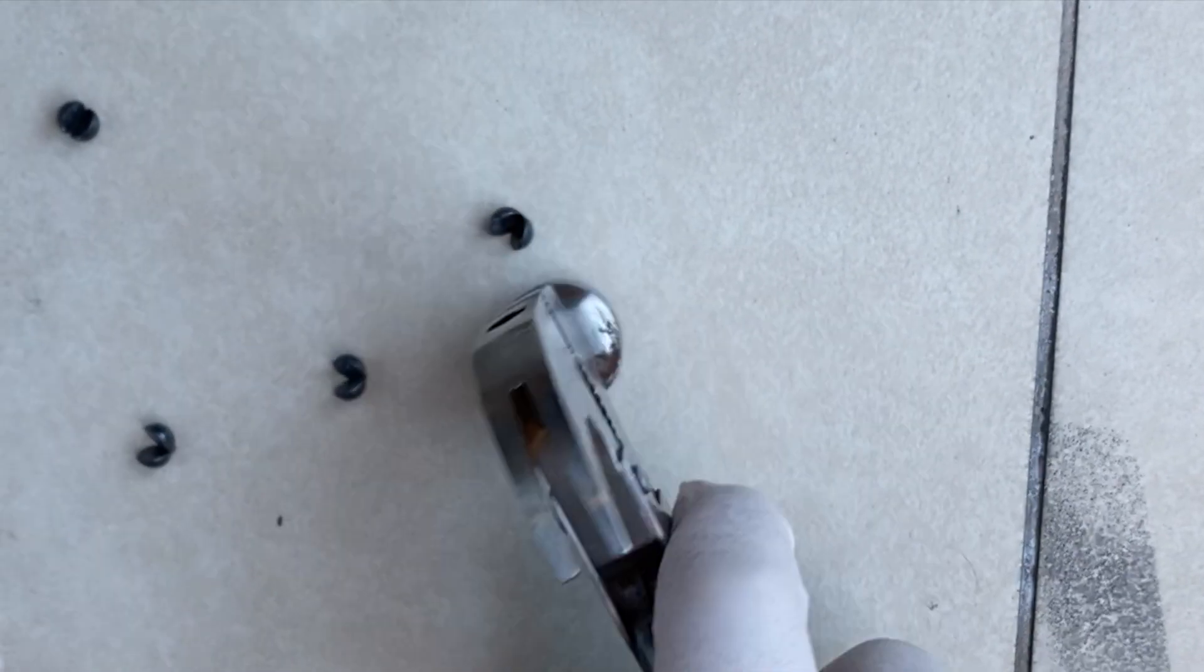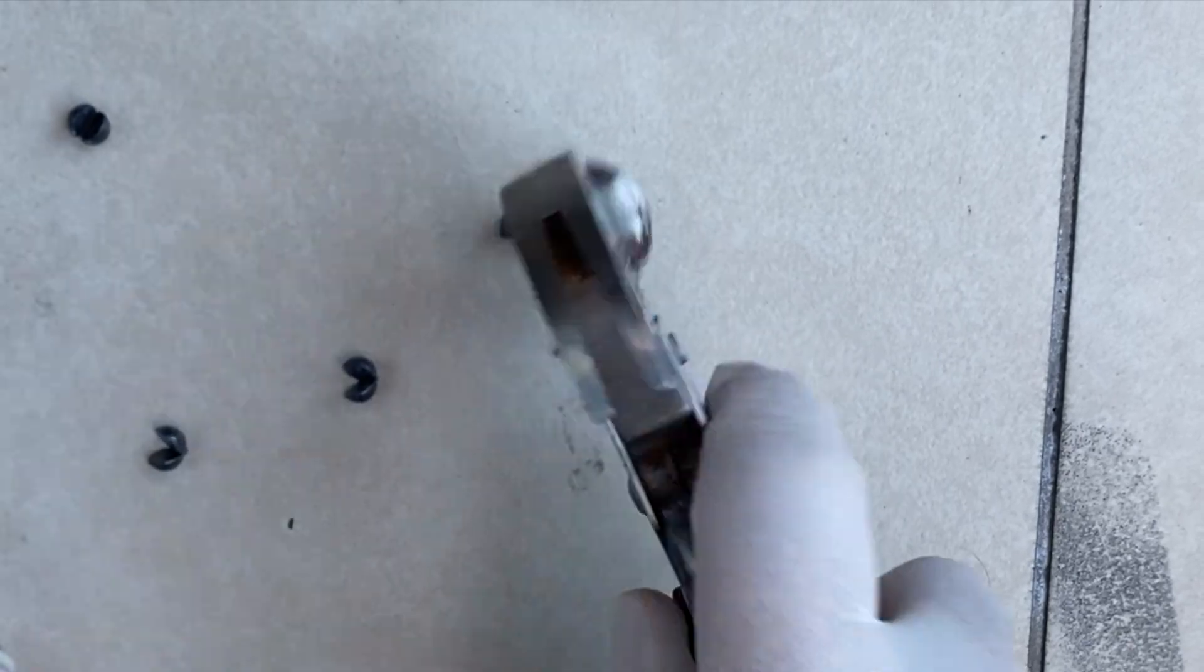First off, we gathered some lead beads and hammered it into small sheets to increase its surface area.